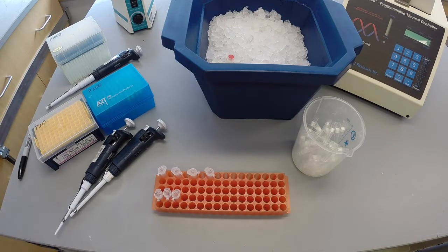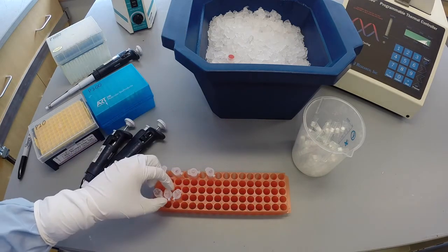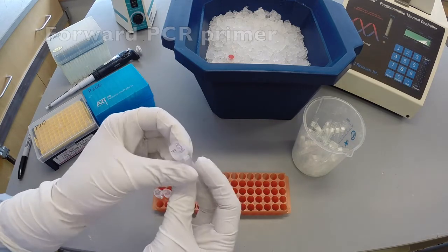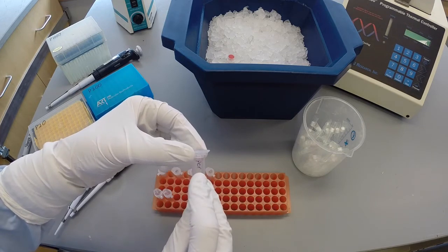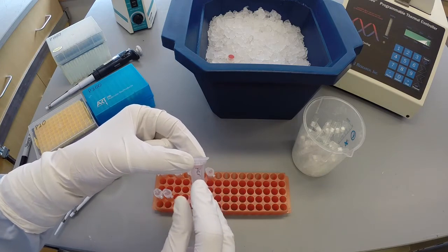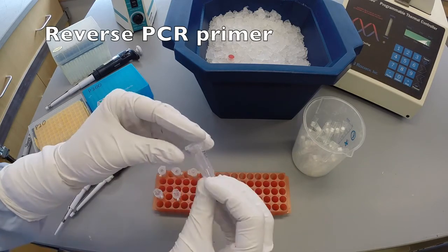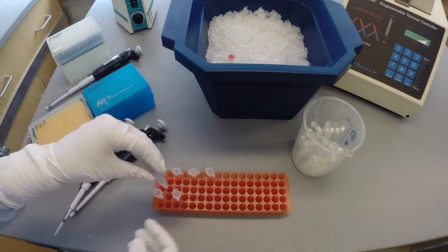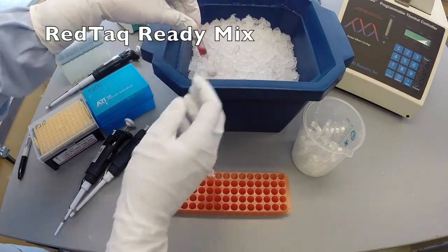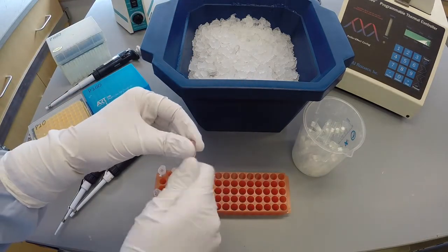The common reagents provided are molecular biology water, a forward primer, which you should be sure to check for the marking of PCR to ensure that you are using the appropriate concentration, a reverse primer, and RedTaq Ready mix. The RedTaq will need to be thawed prior to use, but once thawed, keep the solution on ice to prevent enzyme degradation.